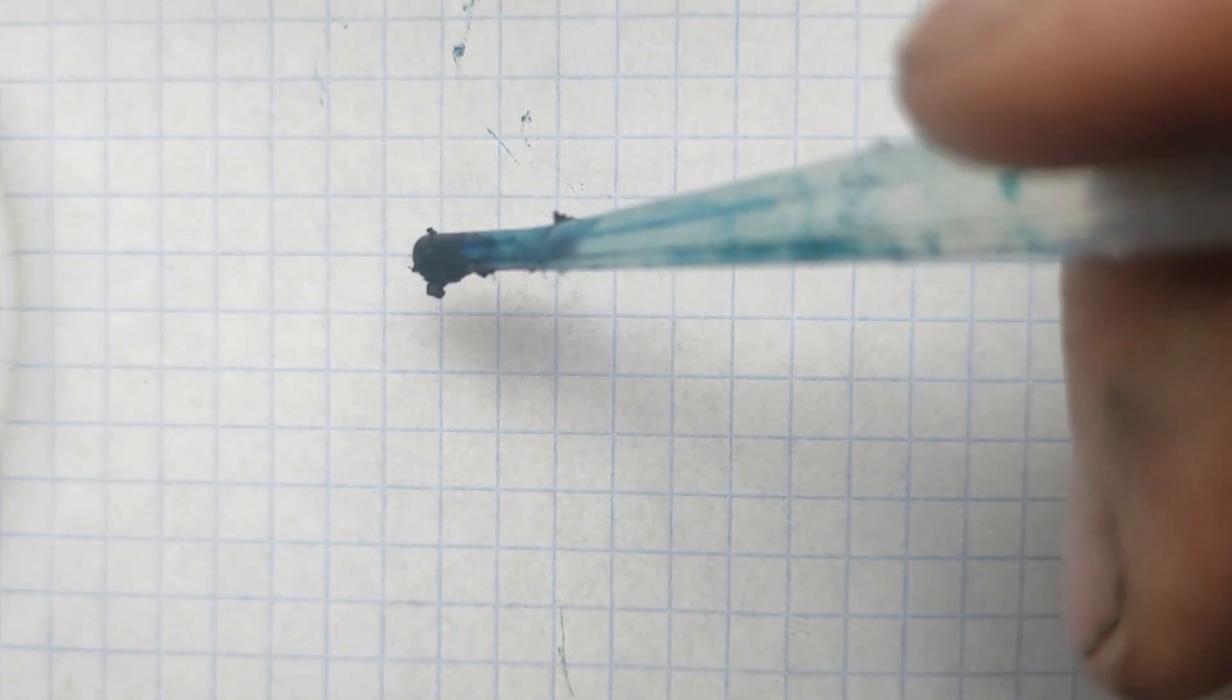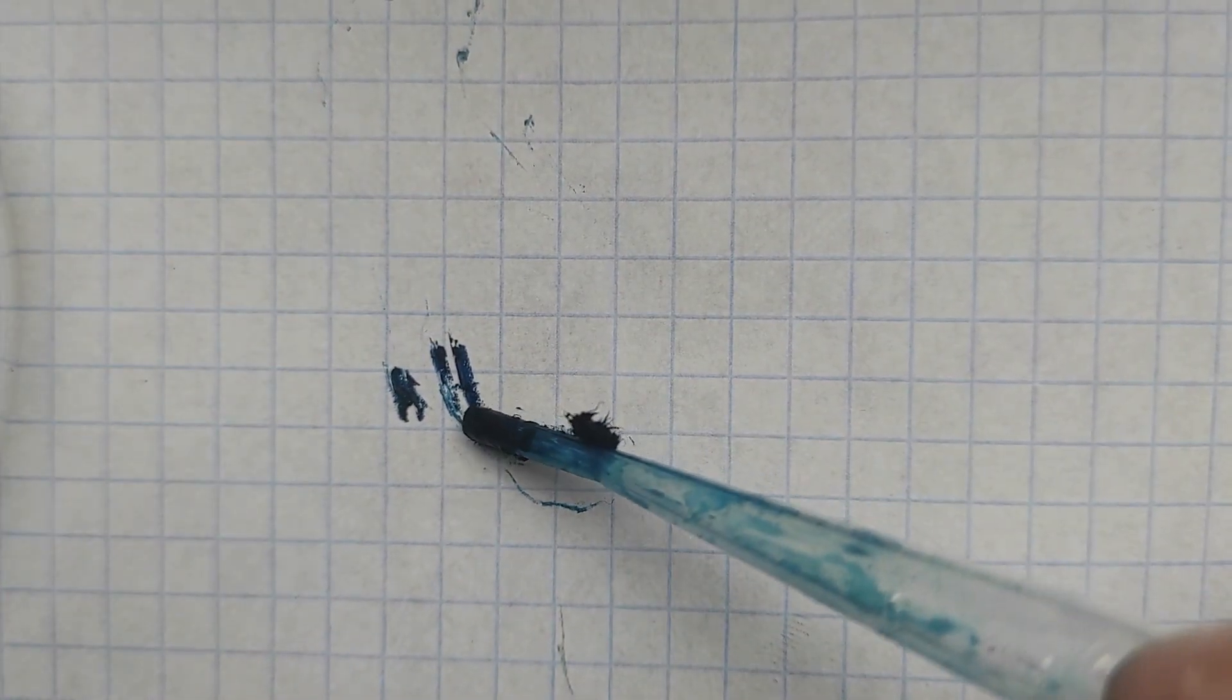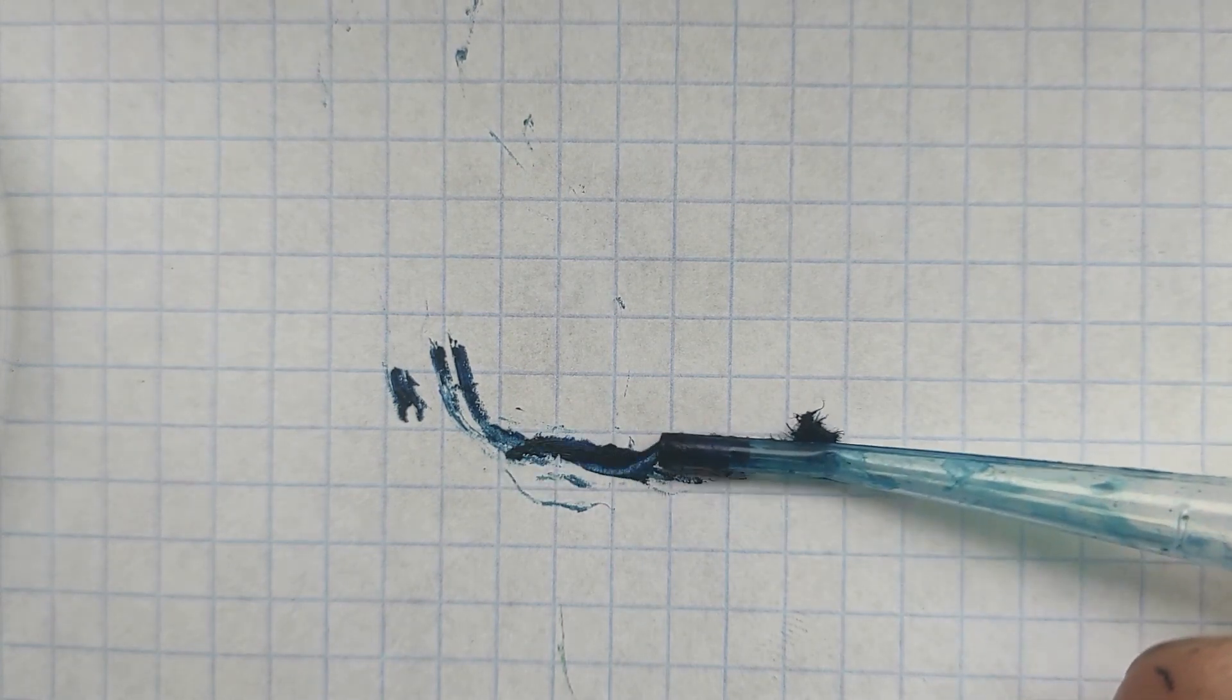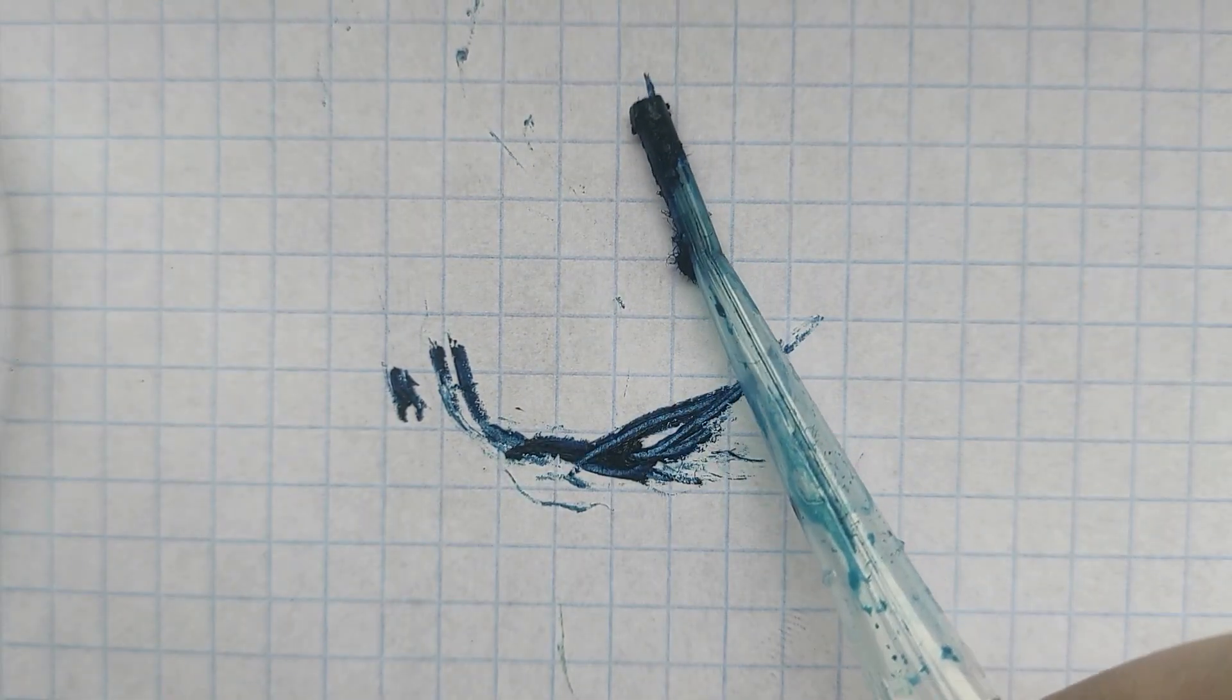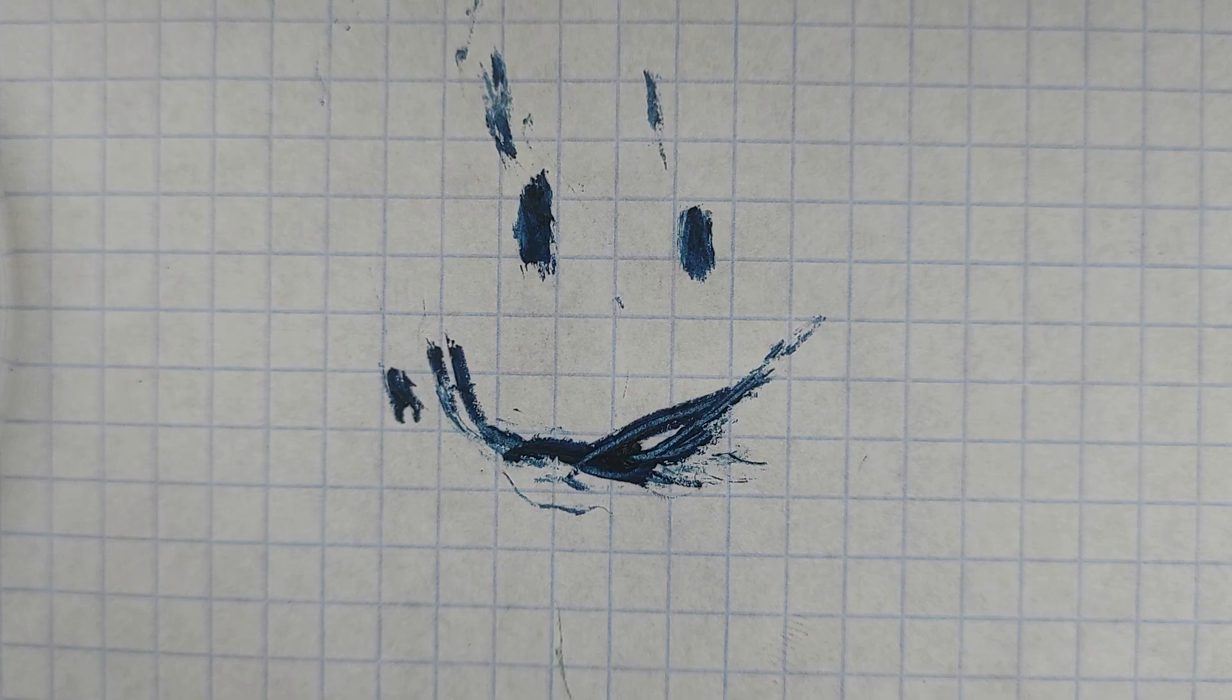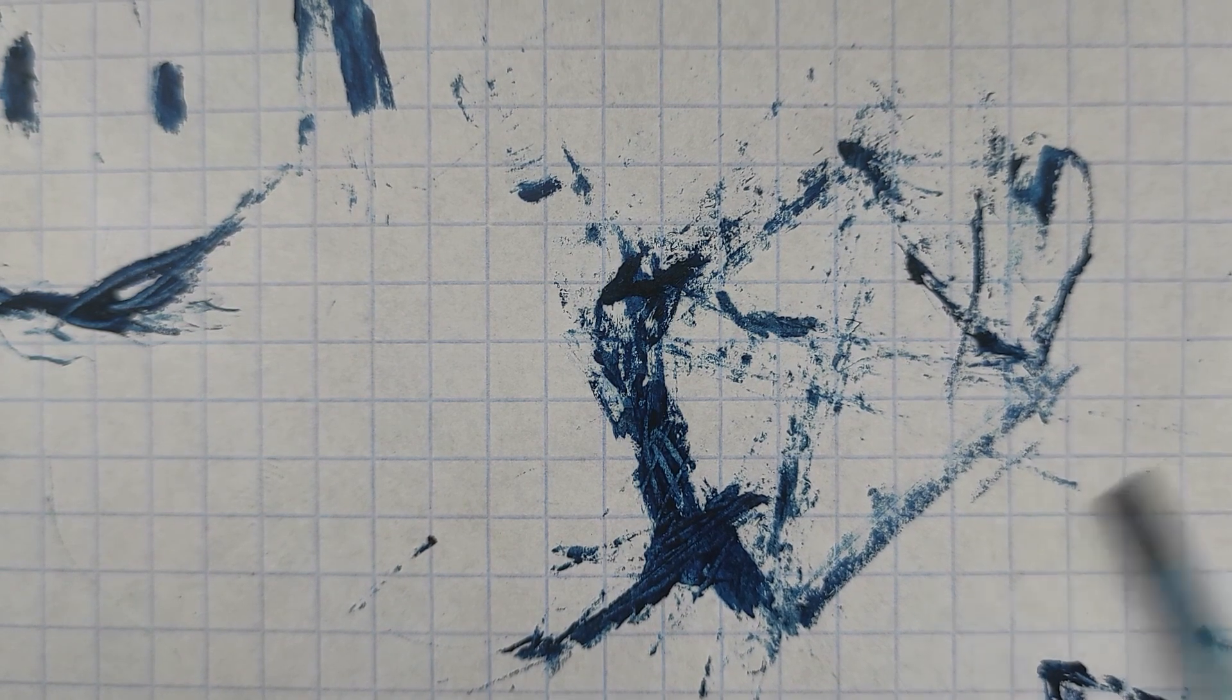Now believe it or not, I'm not an artist but I will try to make something special. By the way, I'm quite literally drawing with a pipette. Okay so now witness my masterpiece. Please don't laugh. Anyway, the second one was much better I think, it kind of gives a graffiti vibe.